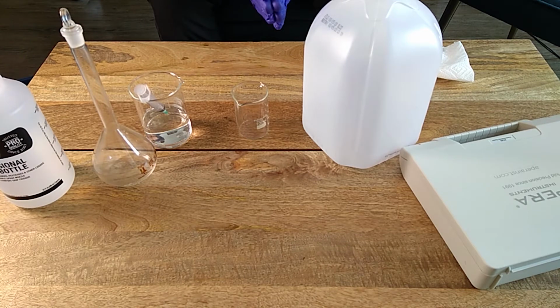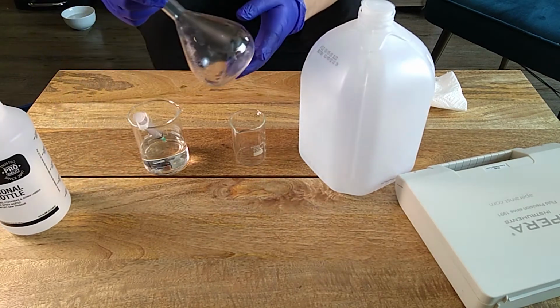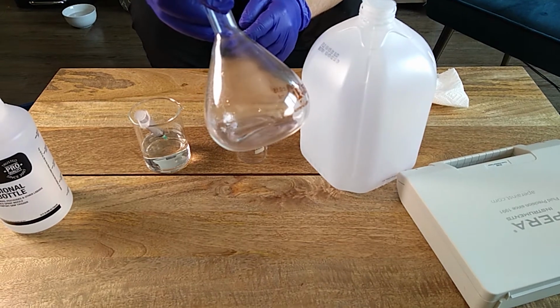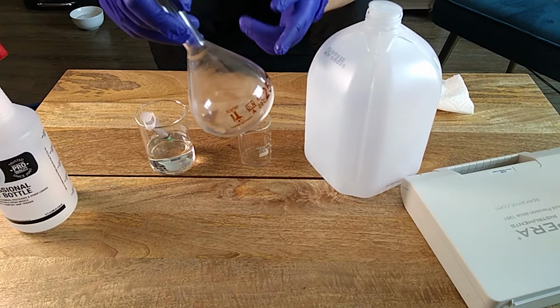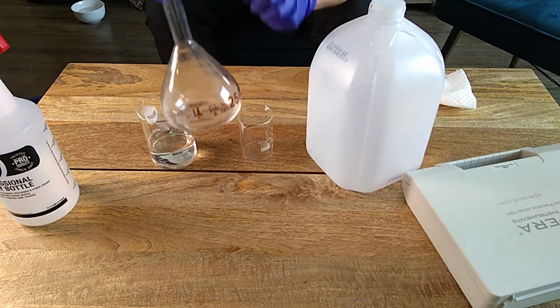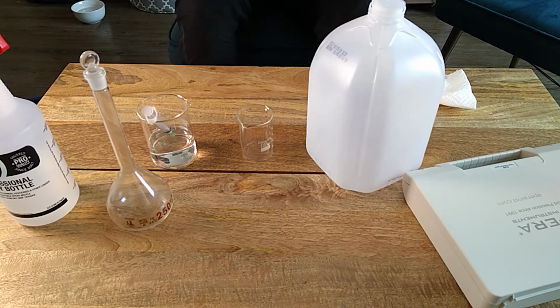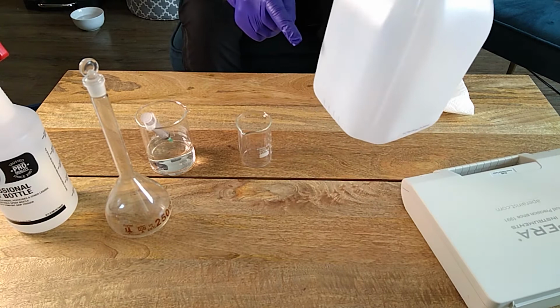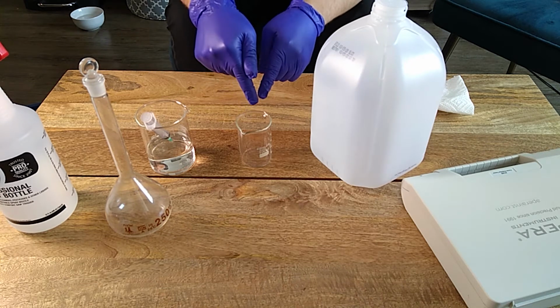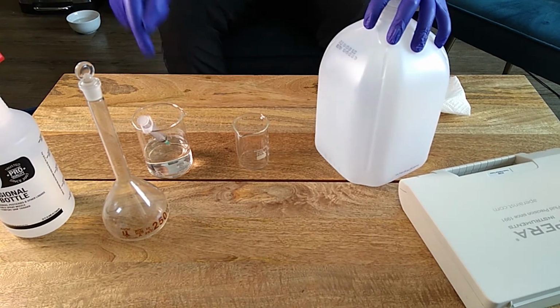So how can we prepare accurate solutions, accurate dilutions? Today I'm going to show you how you can use standardized, calibrated volumetric material, like the one I showed you in my last video, to prepare a very accurate small-scale solution. Then we're going to measure the conductivity of that, and use it as a bridge to prepare an accurate solution of whatever volume we want. Since we will know the exact conductivity, regardless of the volume we want to make, we will know what that conductivity should be when adding a concentrated solution.